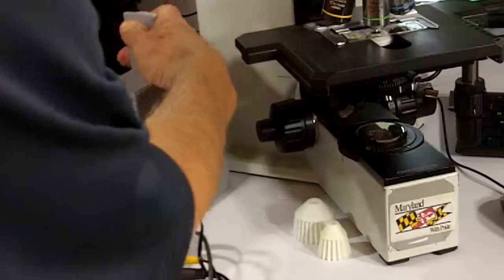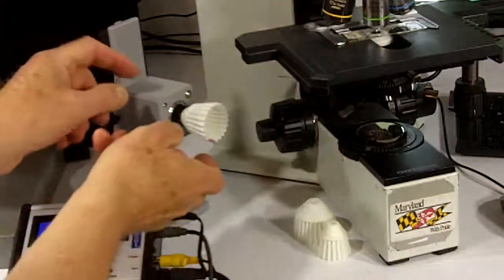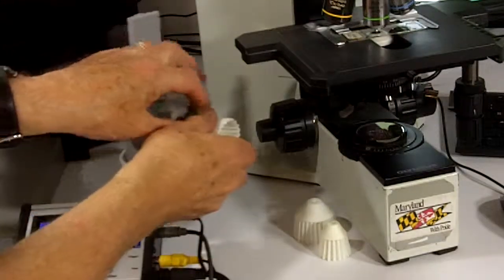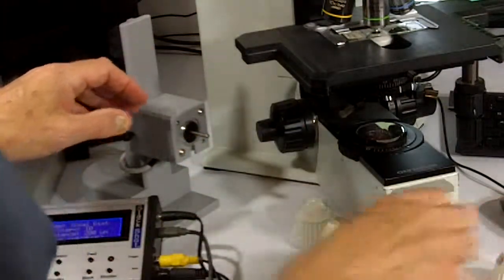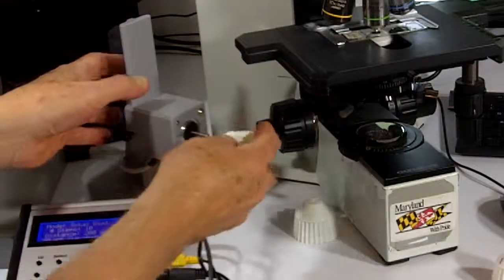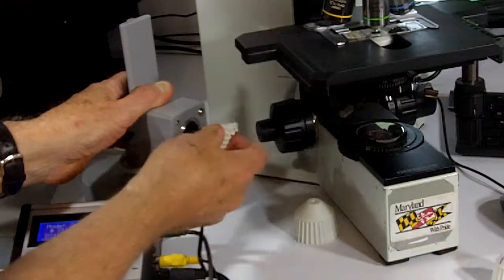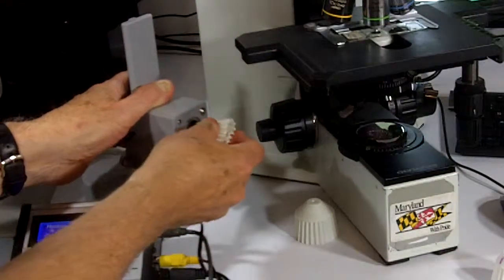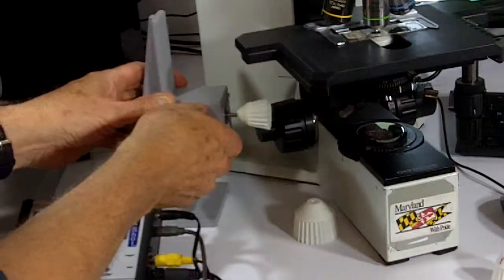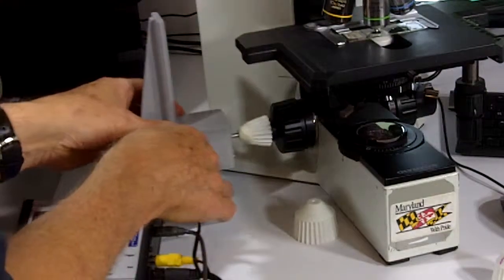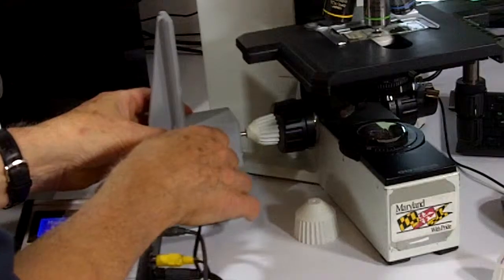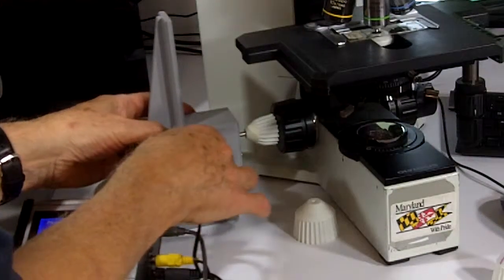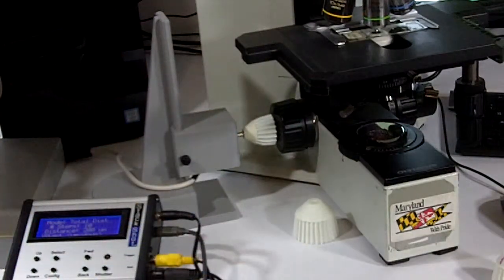I want to show you the easy interchange to change the gripper cups. Take the one off that we had for the Leica, and we're going to now slip on another gripper cup and bring it down a bit and just push it on so you have a good firm fit and lock it down in position.